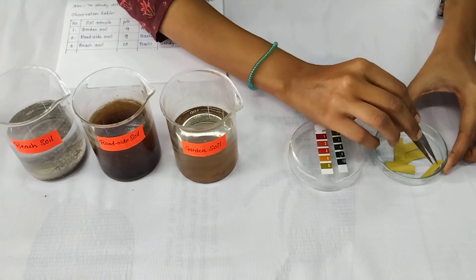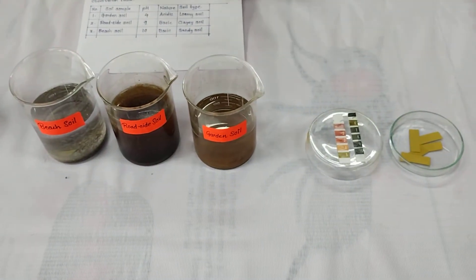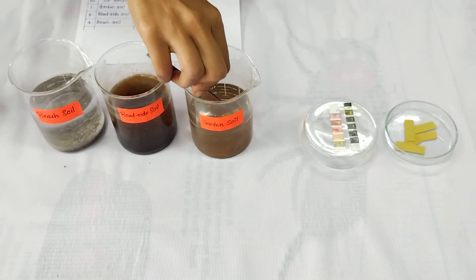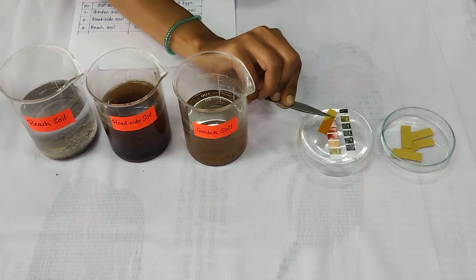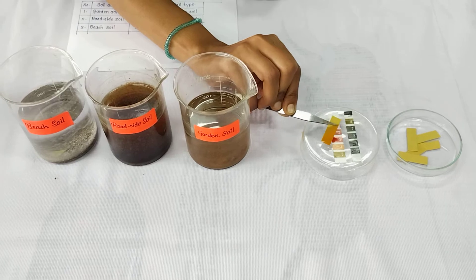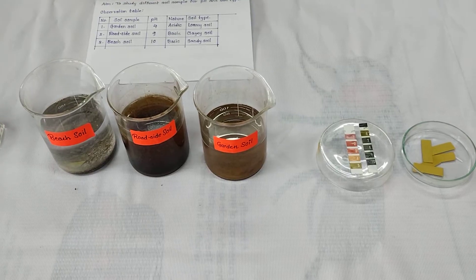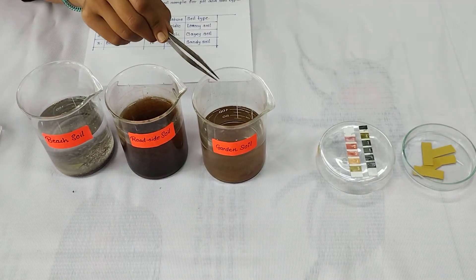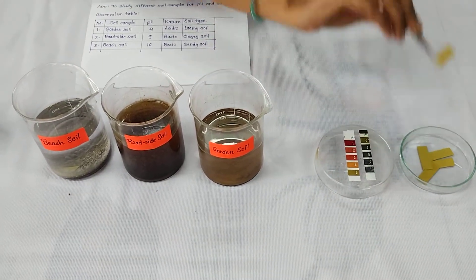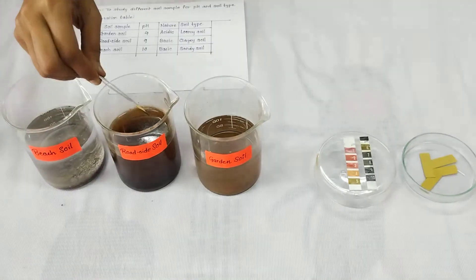For pH, we are going to take one pH paper and dip it in a sample of garden soil. You can see here it matches to 4, so the pH of garden soil is 4, and hence it is acidic in nature.